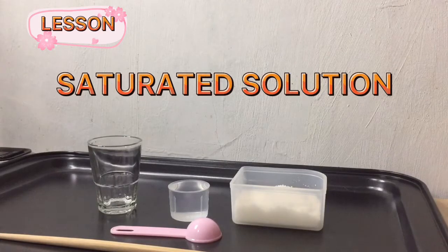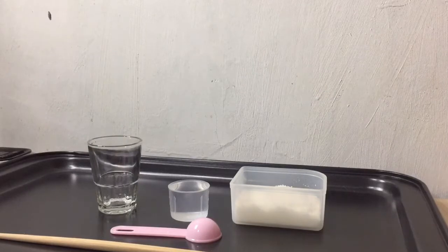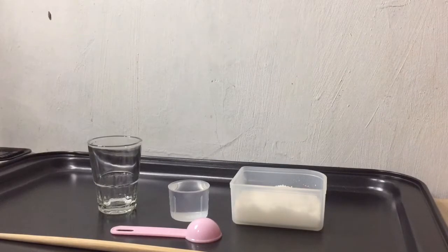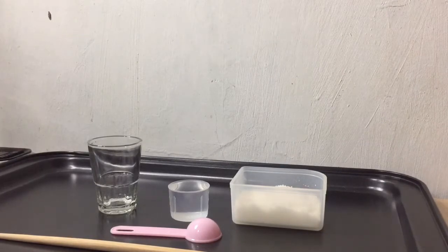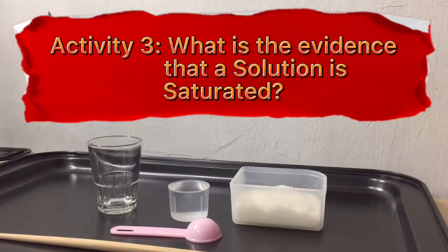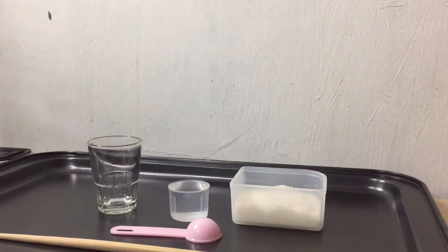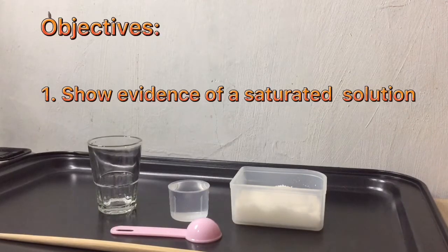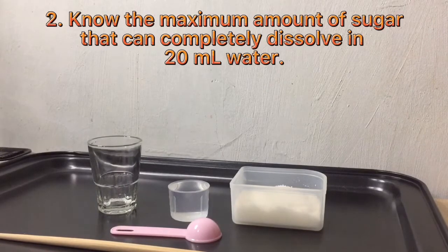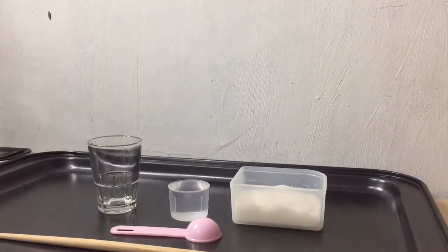In this video lesson, I'm going to show you evidence that a solution is saturated. By watching this video, you can check whether you follow the right procedure in your performance task for output. This activity is based from Module 4, Activity 3, entitled: What is the Evidence that the Solution is Saturated? The objectives of this activity are: first, to show the evidence that a solution is saturated, and second, to tell the maximum amount of sugar that can completely dissolve in 20 milliliters of water at room temperature.